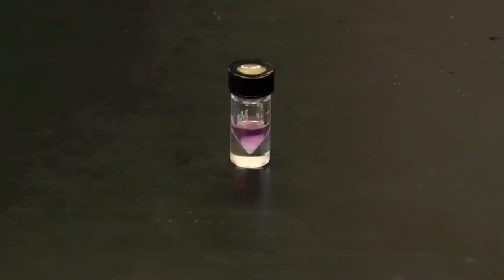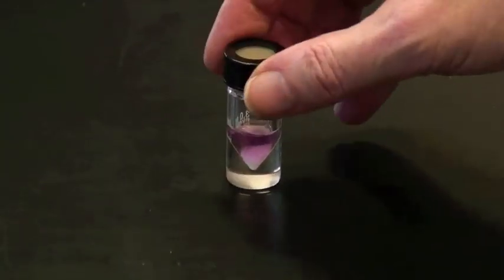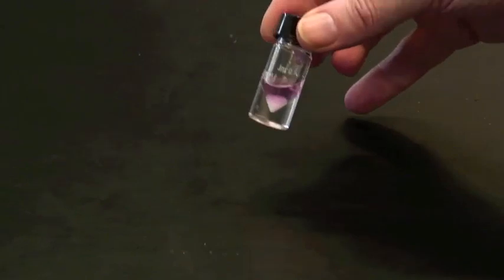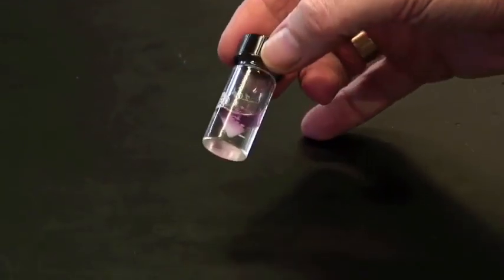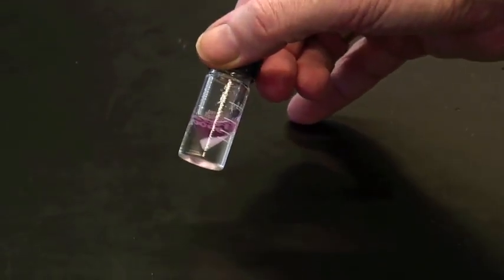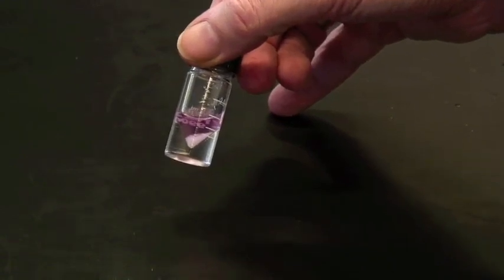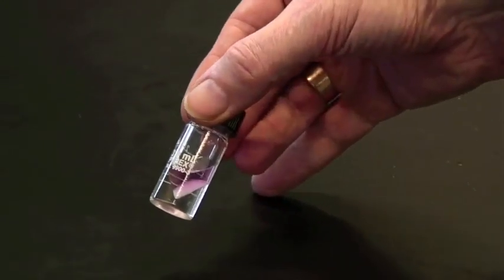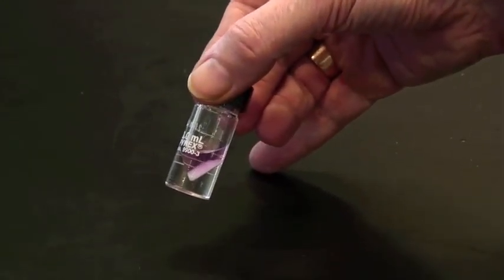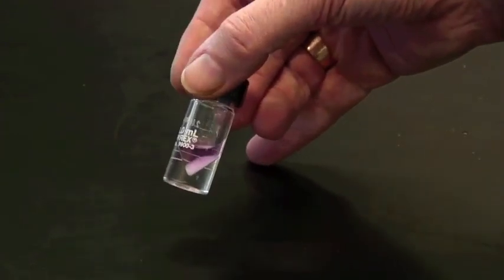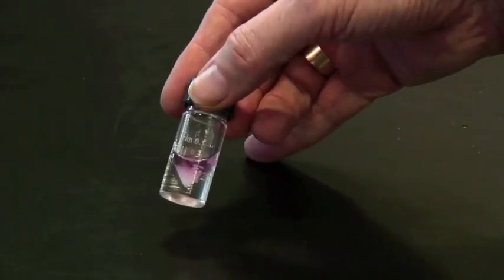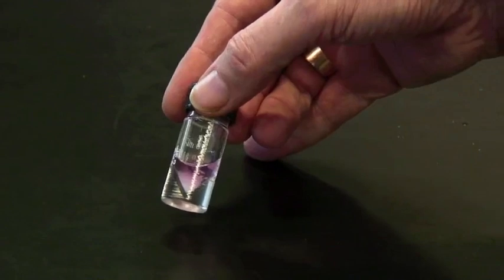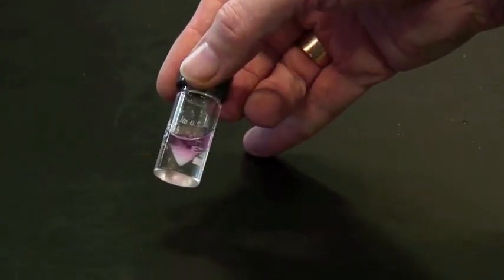It's now been five minutes and this sample has in fact dried. And the way you tell that is twofold. First of all, you look at the liquid and you'll notice it's quite clear. At this point, there's no cloudiness. The other thing to check is the white stuff at the bottom. That is the sodium sulfate, the drying agent. And when you shake it, you may see here that there's a blob that's going to stay stuck to the bottom. This is the sodium sulfate that has done its job. That has absorbed the water present. There's also some loose sodium sulfate that is flowing around freely. This is excess. So you put in enough and a little bit extra. This is the right amount to have put in to dry your sample.